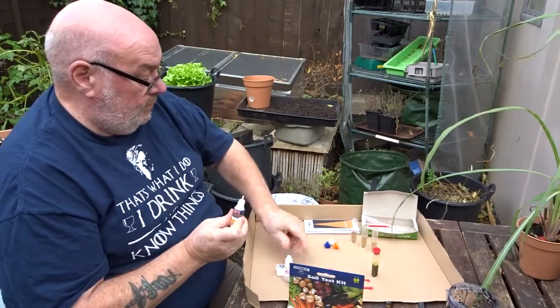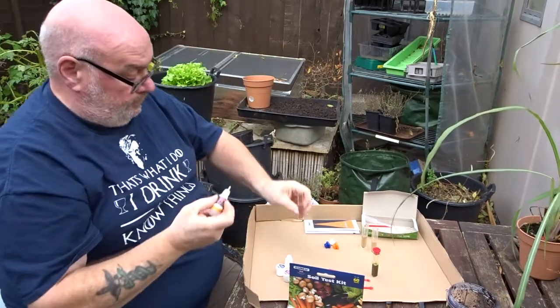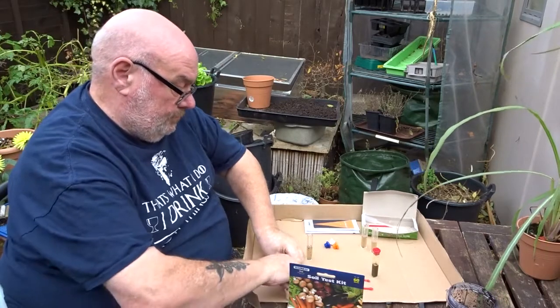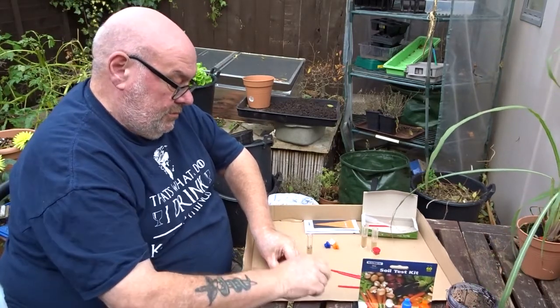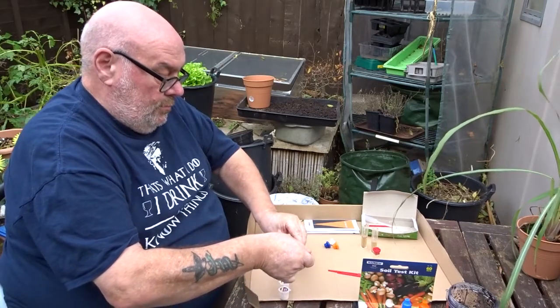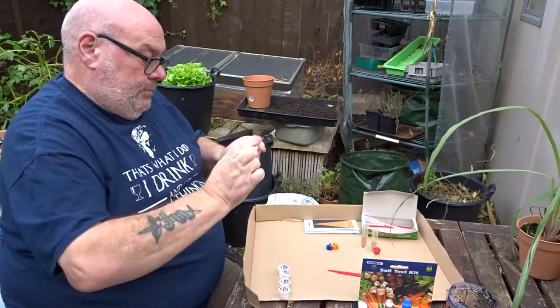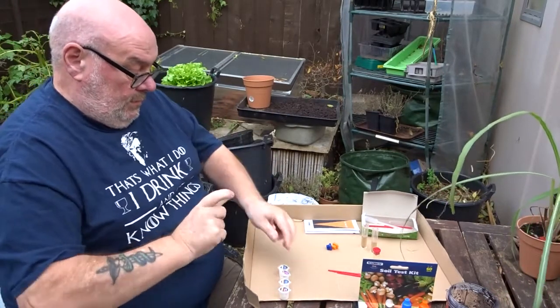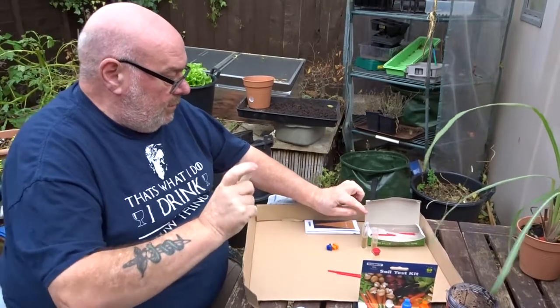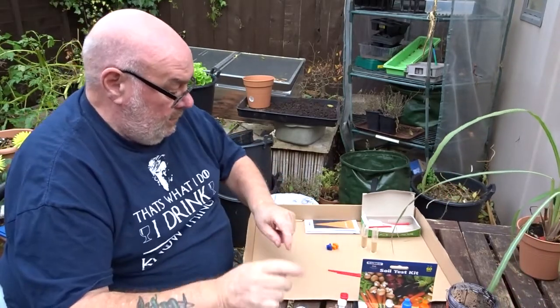Next one — nitrogen. Heap scoop in, and that's white. I'll shake this one a bit longer actually because it's a stiff lumpy powder. Don't blow away — put a cardboard there. I'll put those there so the cardboard doesn't blow away. Blue.